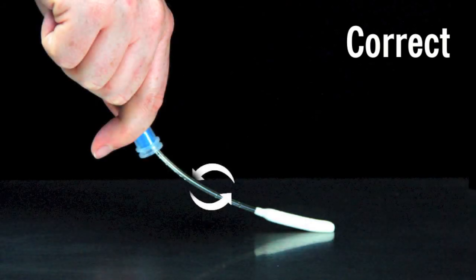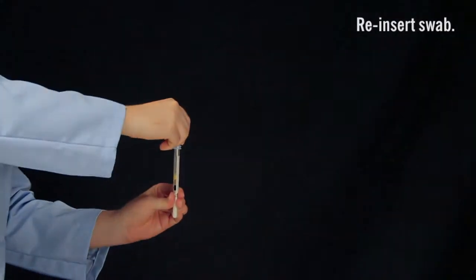Rotate the swab tip while collecting sample to ensure maximum sample collection. Replace the swab in the tube.